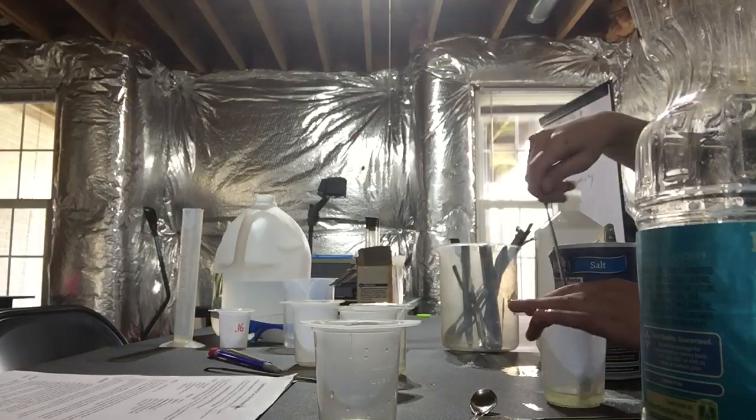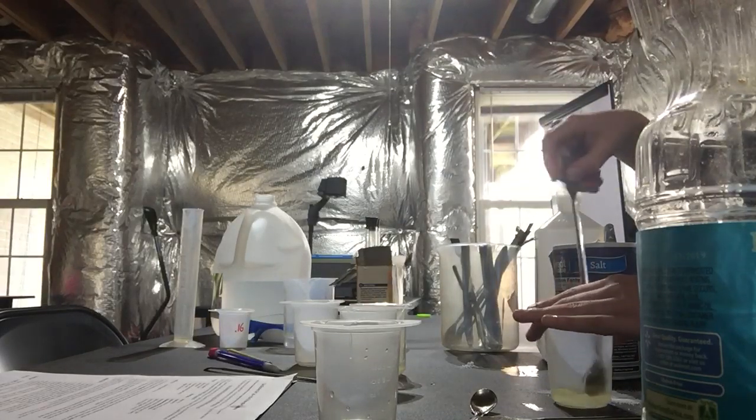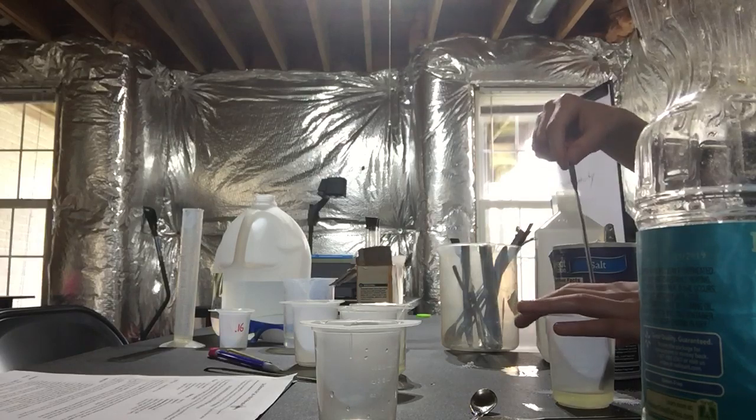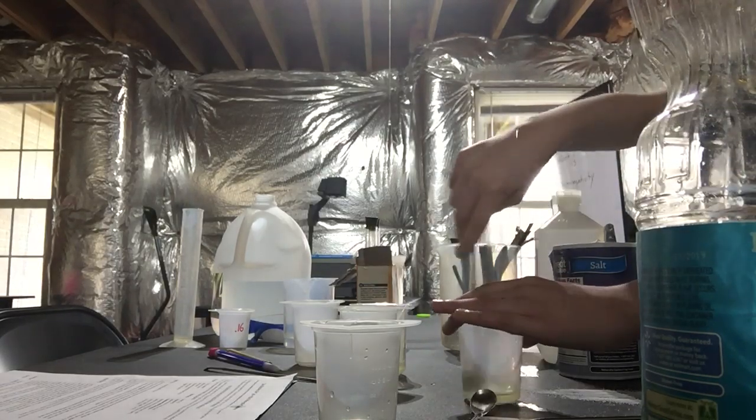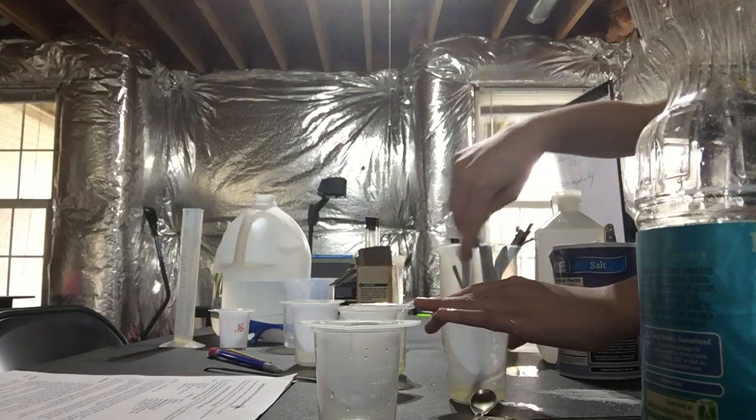Wait, is this on a script? Yeah, I'm definitely not reading off. Yes, we will go in silence for the next few seconds when I stir this.